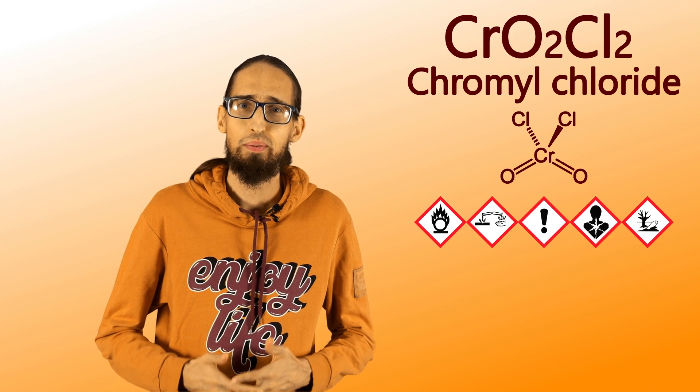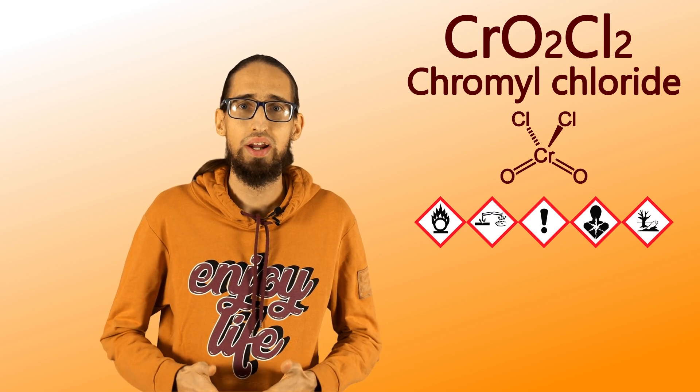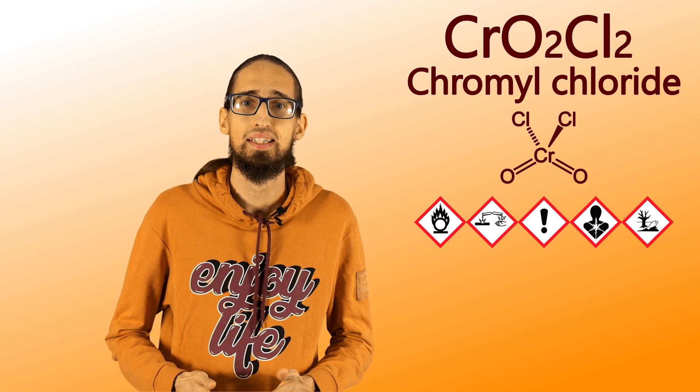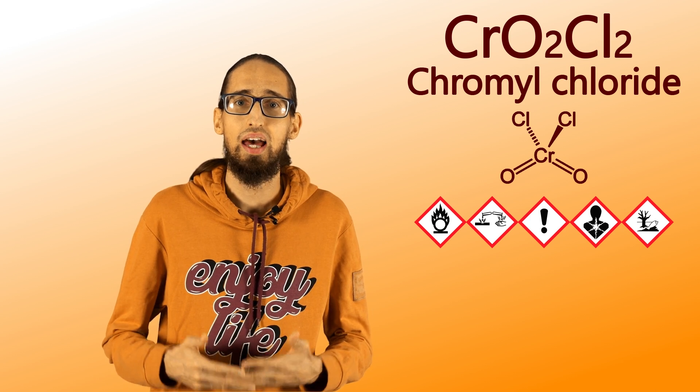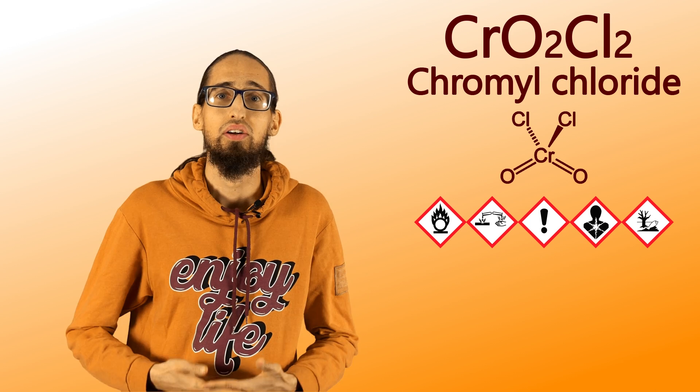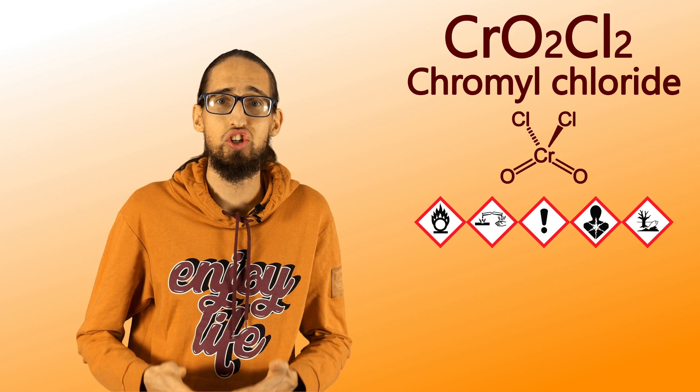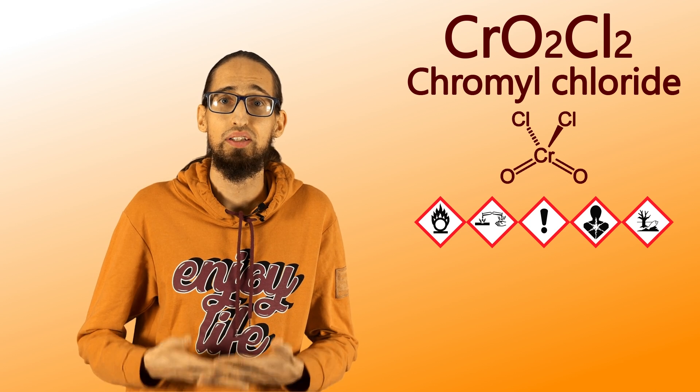Today I'm gonna show you hypergolic reactions with chromyl chloride. Hypergolic reaction is one whose components spontaneously ignite when they come into contact with each other. Chromyl chloride is highly electrophilic and an aggressive oxidizing agent that inflames a lot of materials on contact.